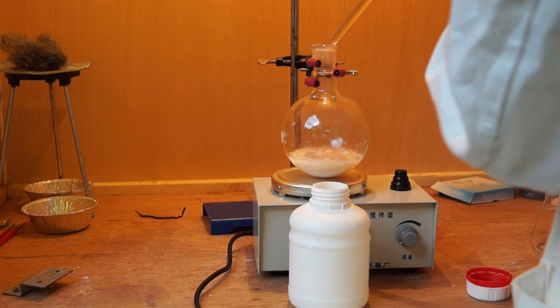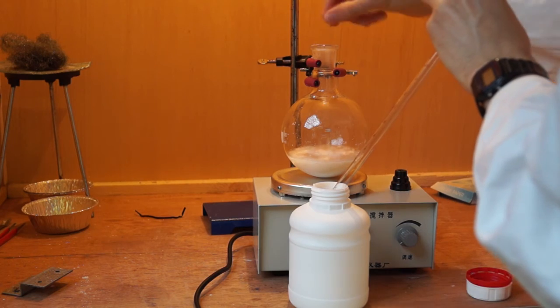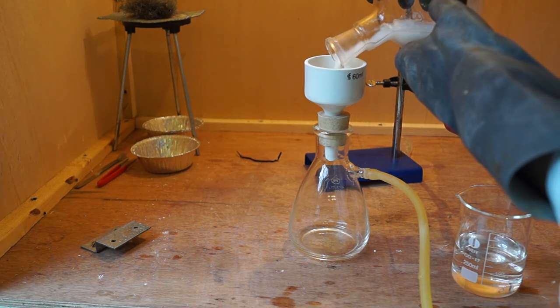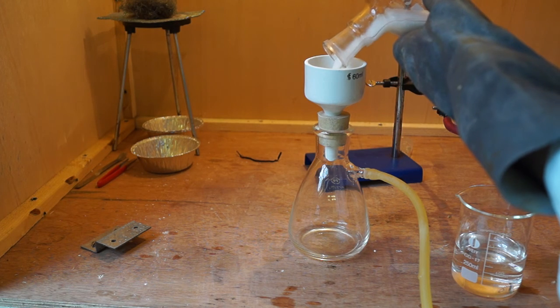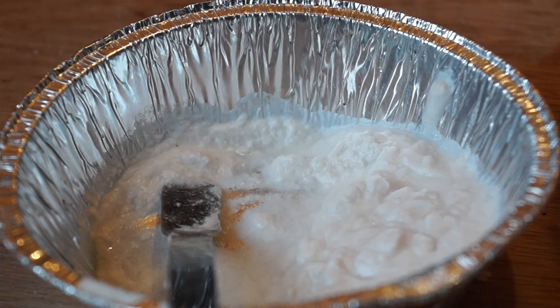Salicylic acid is practically insoluble in water, so precipitates out of the solution immediately as it's formed. To separate the precipitate from the solution, vacuum filter the mixture, taking care to wash the precipitate with distilled water to remove the excess HCl and acetic acid from the precipitate.